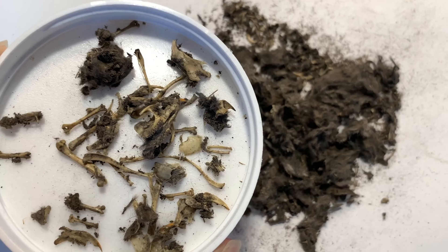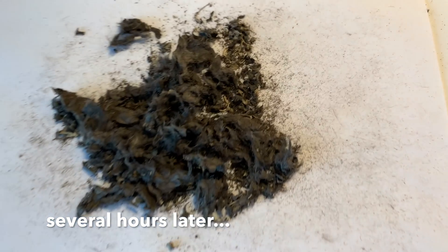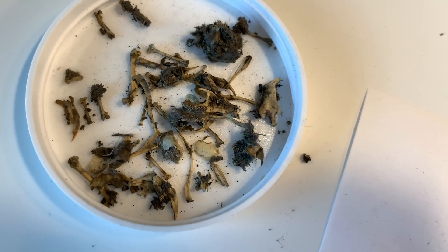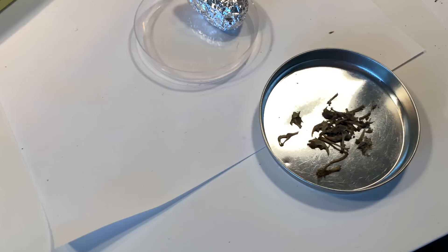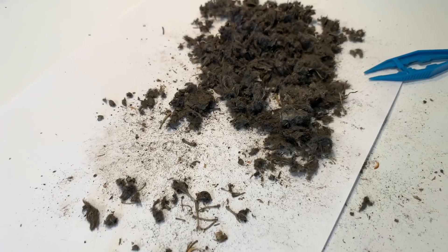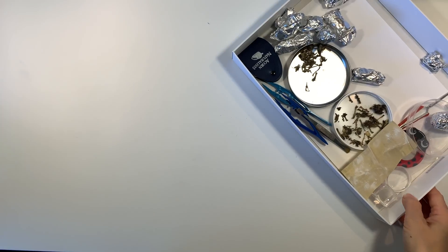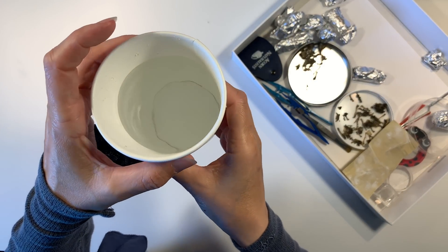There is a lot of stuff to go through when looking through these owl pellets. There's a lot of fur and things you can discard, but then there are a lot of bones and really tiny bones — it does take a while to sift through, and after several hours we kind of needed a break. My son was able to find a lot of large pieces that looked really good and didn't need a lot of cleaning. Now I'm going to show you an alternative to going through these owl pellets dry.